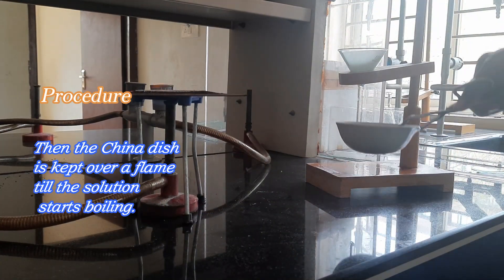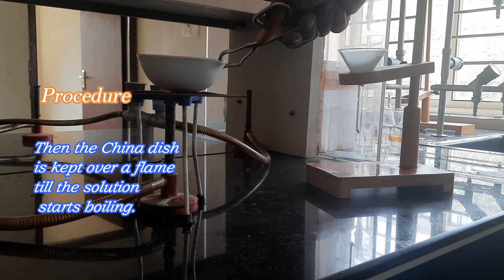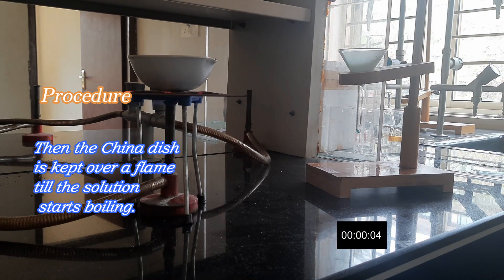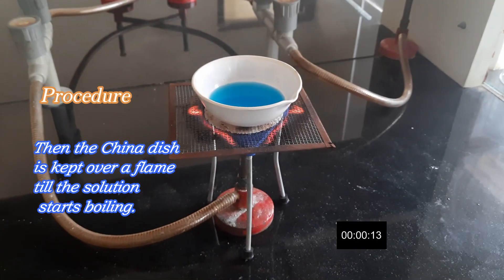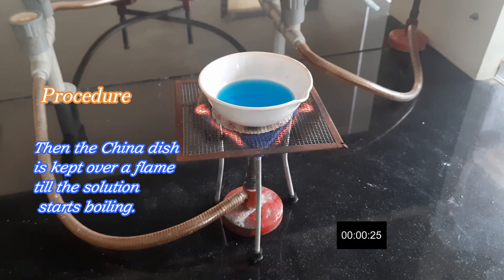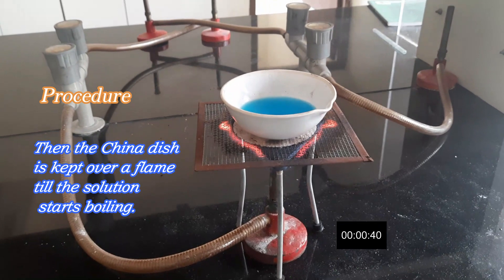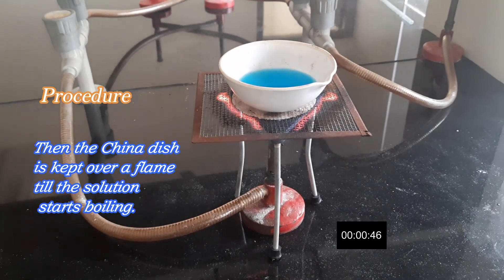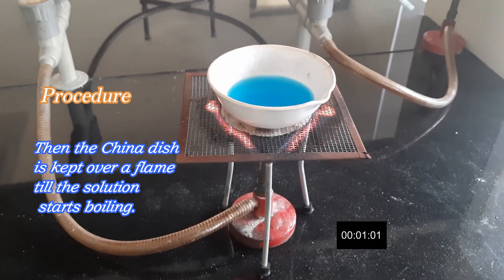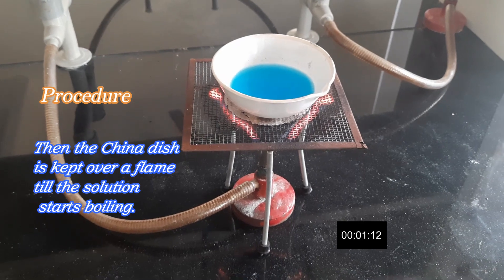The china dish is kept over a flame till the solution starts boiling. The impurities remain on the surface.